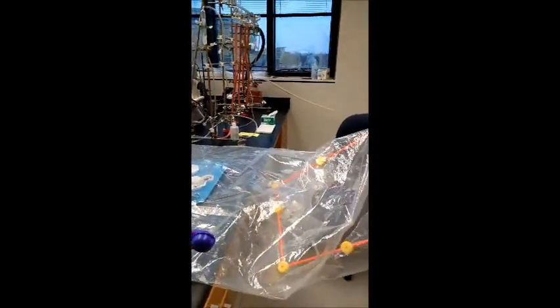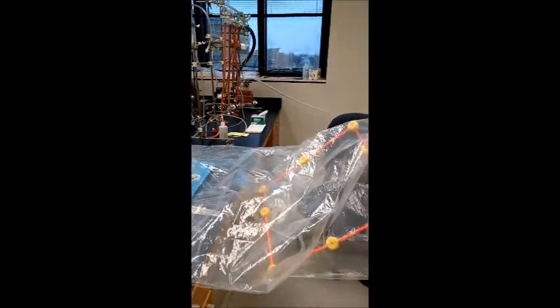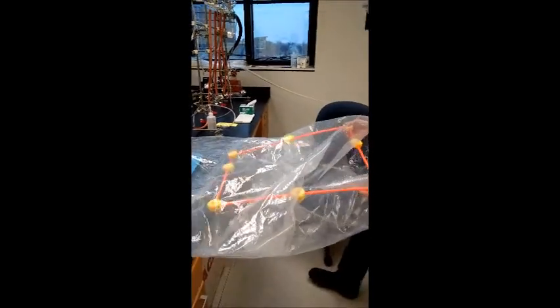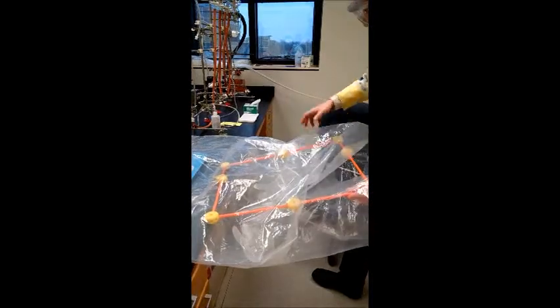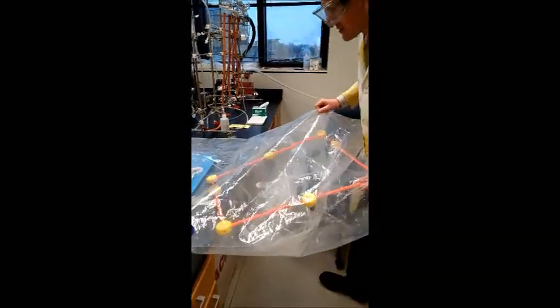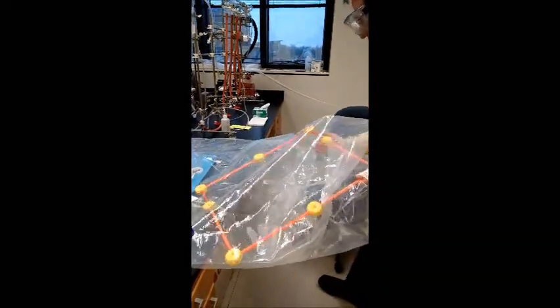The frame needs to be able to fit into the opening. I already have a tray to protect the base of the glove bag with the supplies I need for this operation.